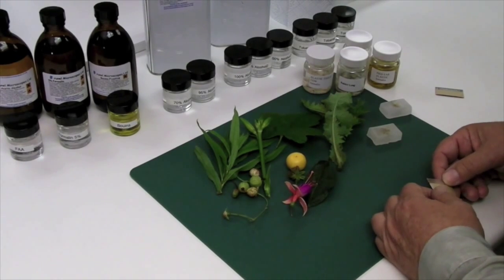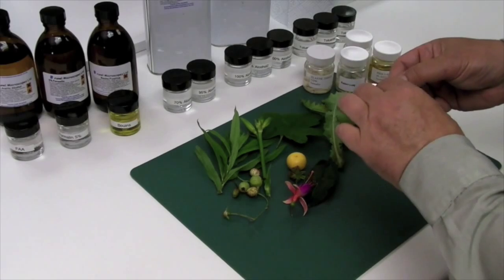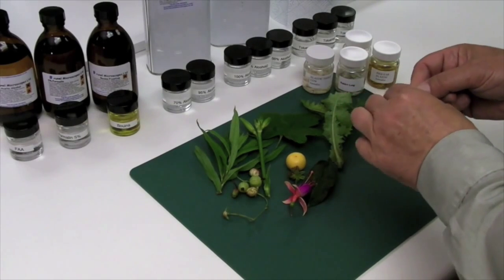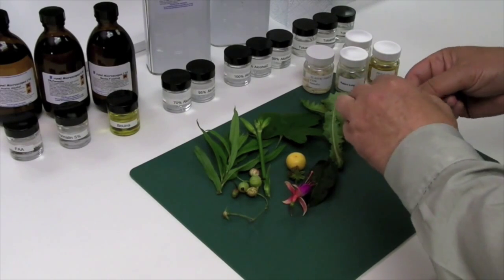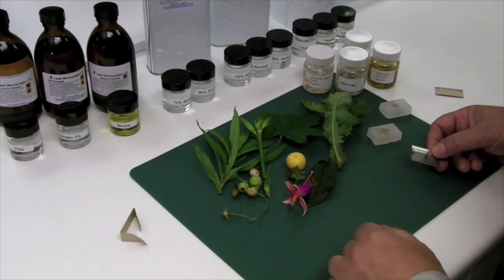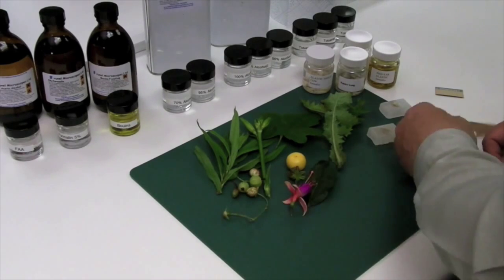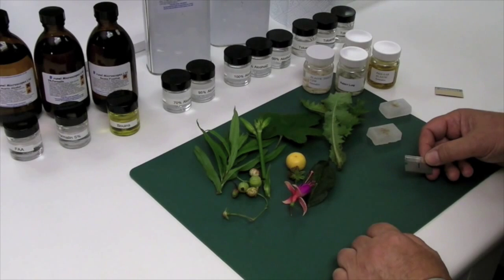Select pieces with a sharp knife or a safety razor blade, which is particularly ideal for this purpose. Think ahead to how the material will look in a wax block, and how you can select pieces from the specimen that will represent the structures you wish to see.